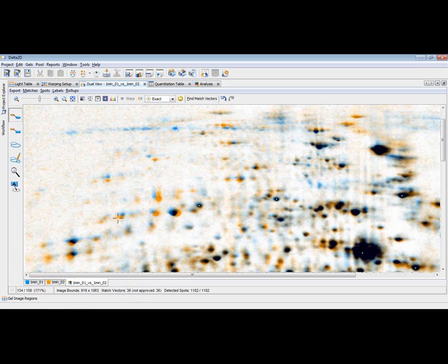Now we have that. As you can see, there's a number of match vectors. There's a number given in the status line. Delta2D has found 36 match vectors, and we can now zoom in and review this if we like, and have a look at the result of this warping. And as you can see, which is typical, close to the borders, there are still some shifts in spot positions, which you can then correct. And you can do this stepwise.